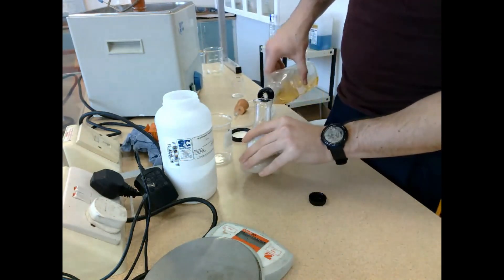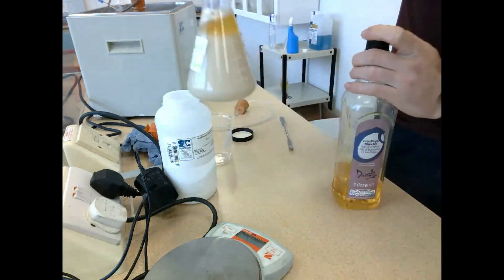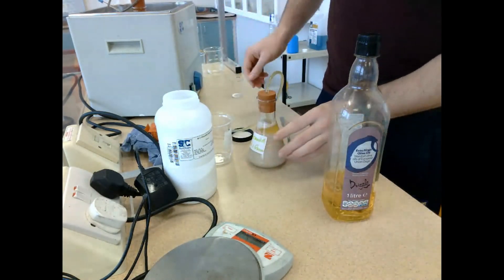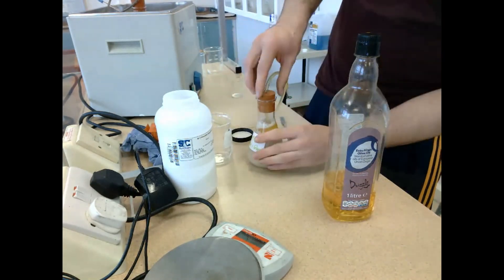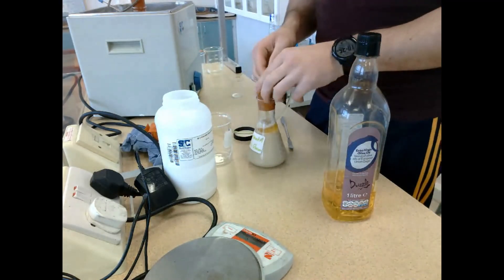What we're going to do is take some oil and add it to the flask to ensure the anaerobic conditions stay that way, as no oxygen will be able to get through that oil layer. Once the oil is there, we stopper this flask with a tube coming out of it and then we place this flask into the water bath as well.